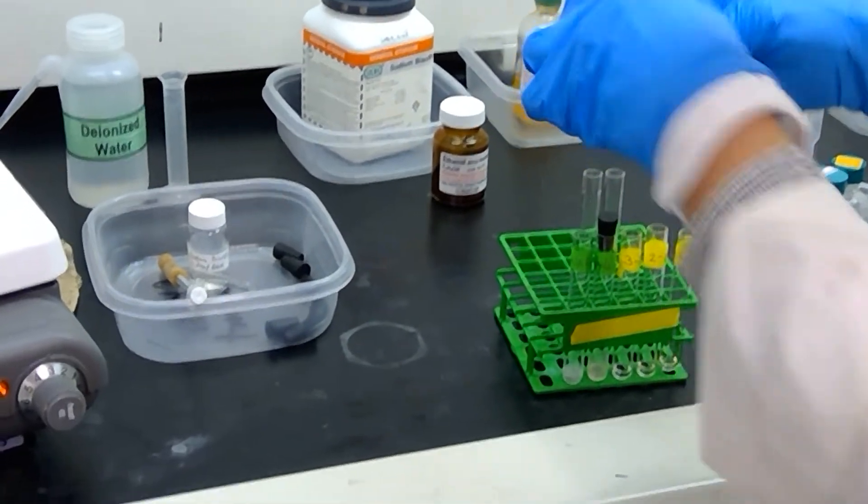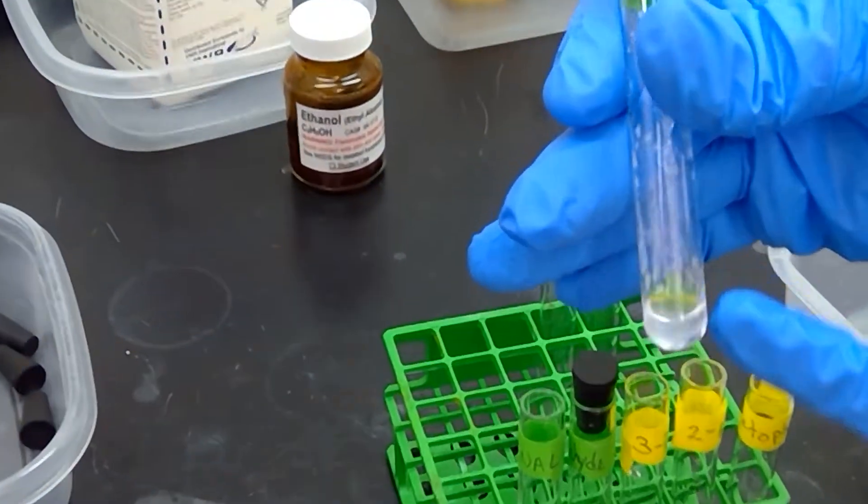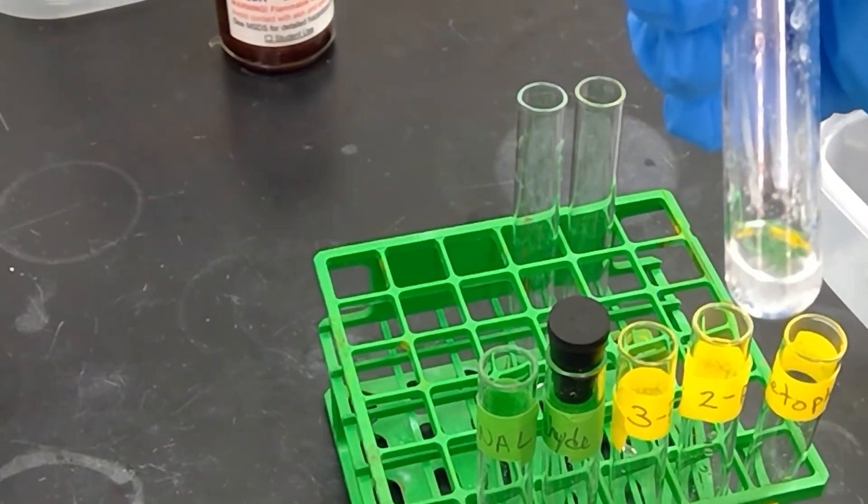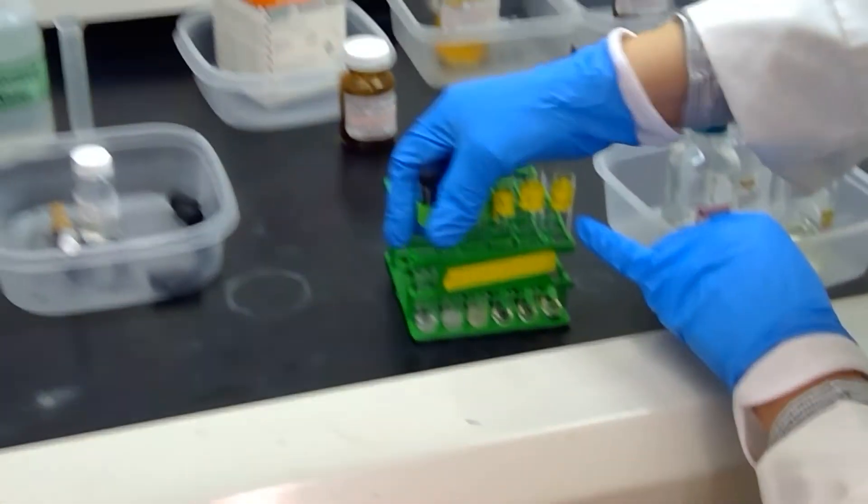And if we go back to the acetone sample, the acetone sample is definitely precipitating a whole lot more now that we've let it sit for a few moments.